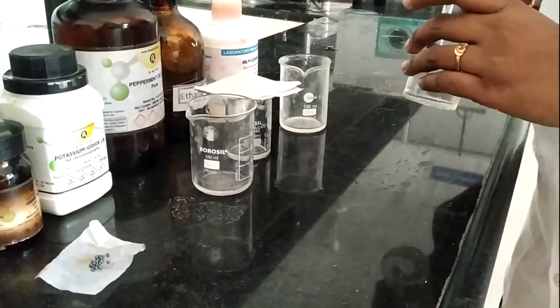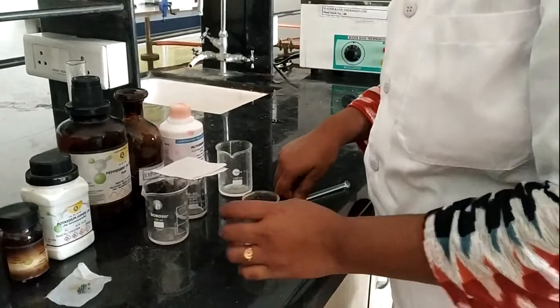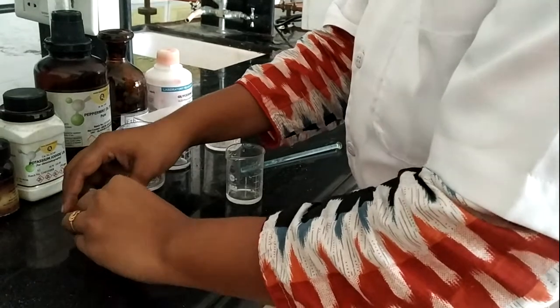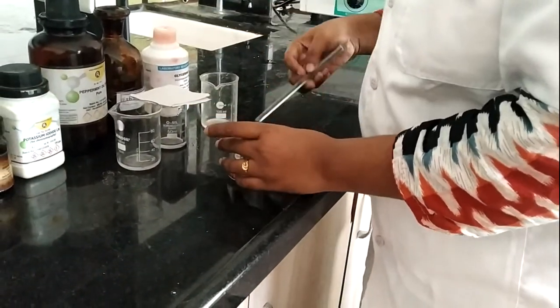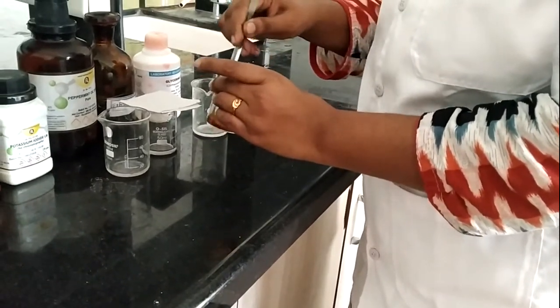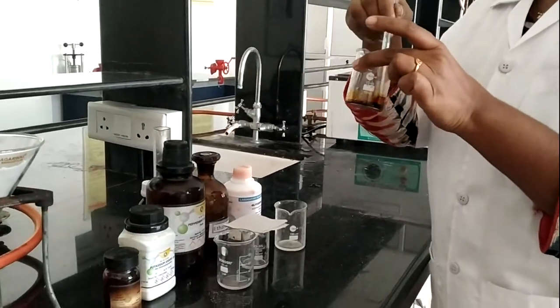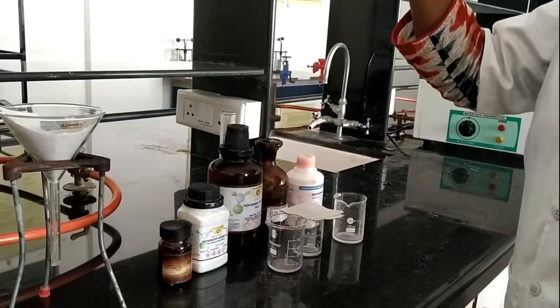After adding potassium iodide, stir it. After dissolving potassium iodide, add the crystals of iodine into it and stir vigorously. The iodine, potassium iodide, and water mixture solution is now formed.